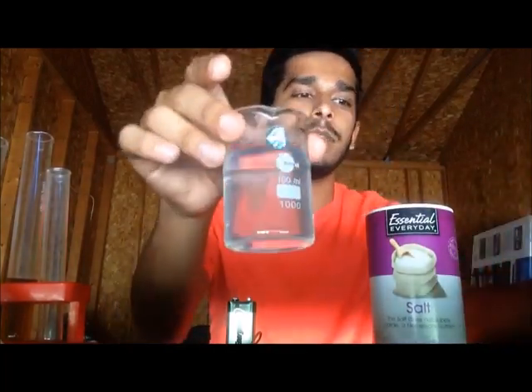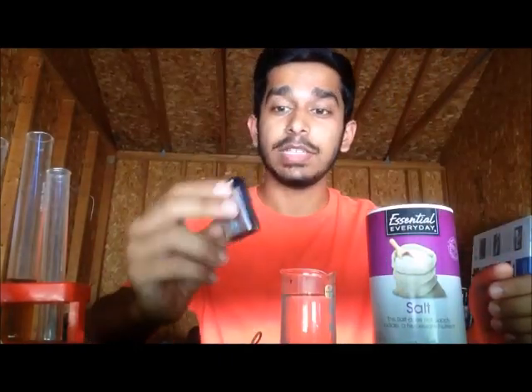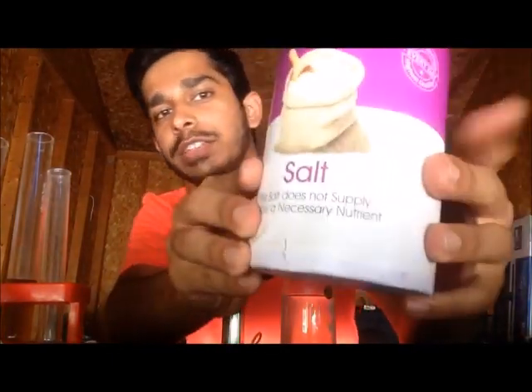In this beaker you can see I have some sodium chloride solution already prepared, and here I have this 9-volt Energizer battery. For this reaction I want to make sure that the salt is not iodized.